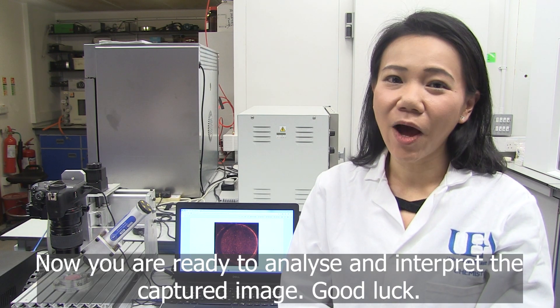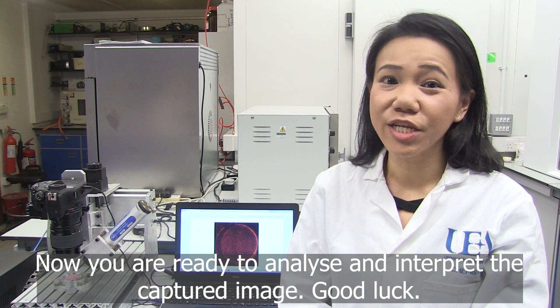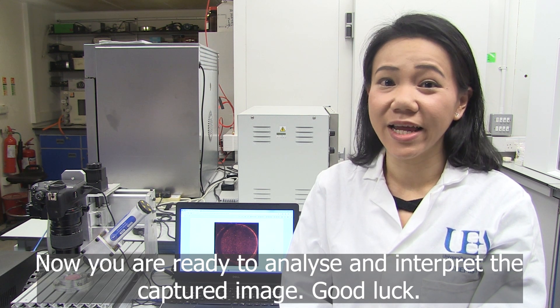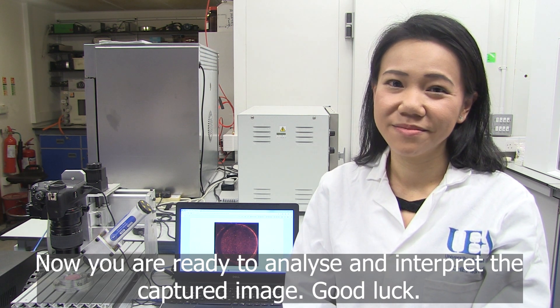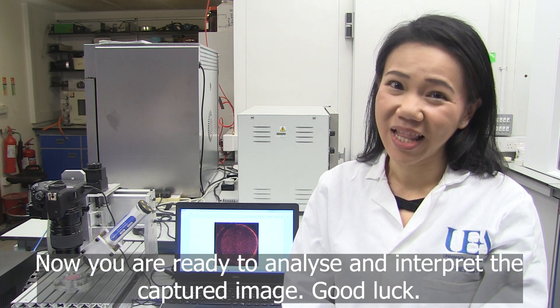And now you are ready to analyse and interpret the captured image. Good luck!